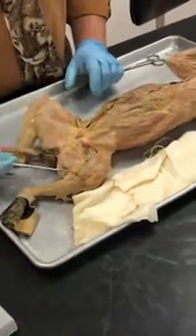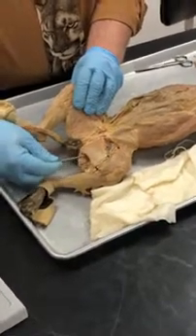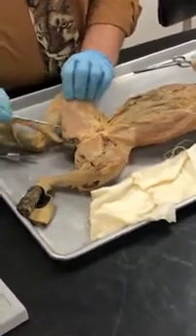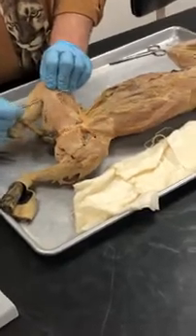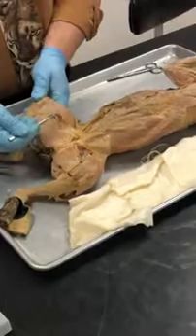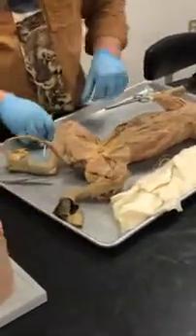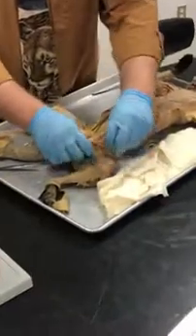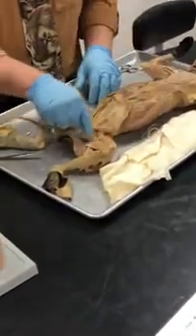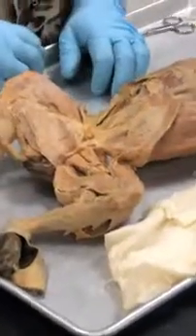The gracilis is going to be this one over here, okay? So the gracilis is this, and the sartorius is going to be over here, okay? Very wide and covering most of the muscles, but if we cut over here and reflect it back, oh, look at all those goodies we got in there, okay? So we're going to go into there and see what's going on, all right?